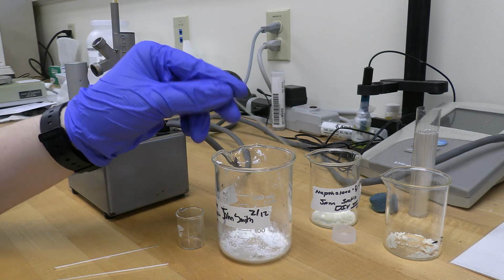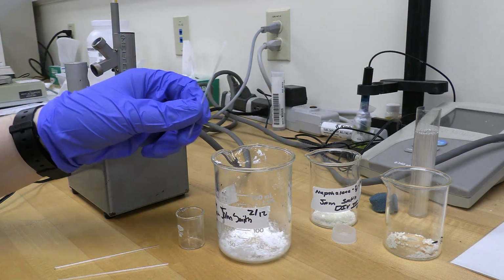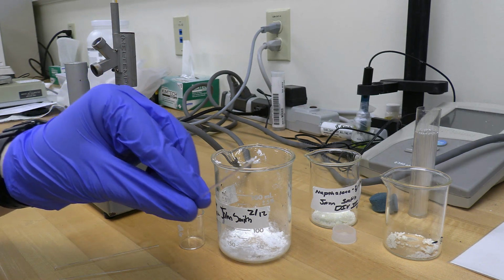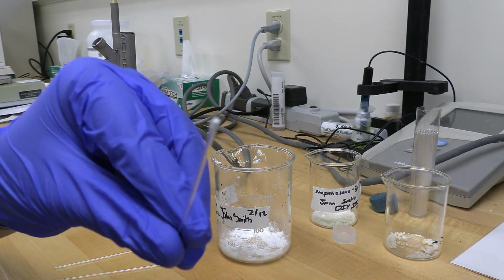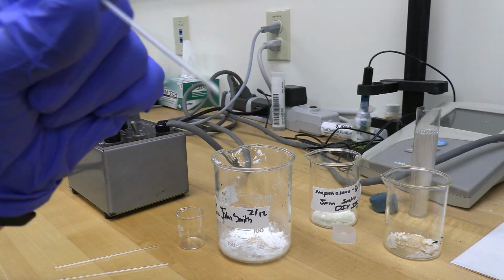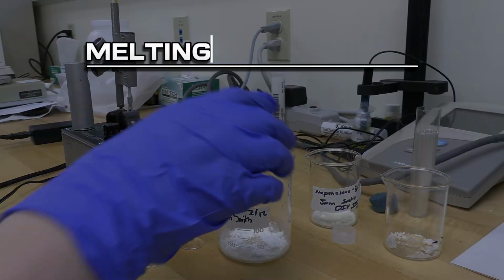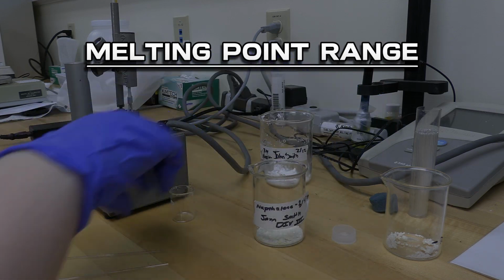To get your solid product in the capillary tube, simply take your tube, flip it upside down, and place it inside your beaker or flask, and simply tap a few times to get the product inside the tube. Then, take it out, flip it over again, and tap it on your bench until the product falls to the bottom of your tube. Once it's in the bottom of your tube, you can place it in one of 3 chambers. While I add the other 2 compounds into their tubes, I'll explain the melting point range.